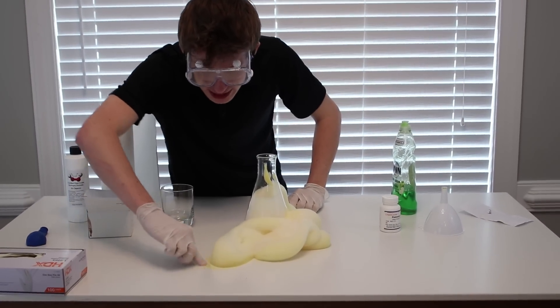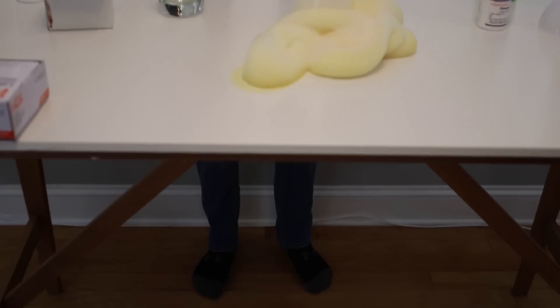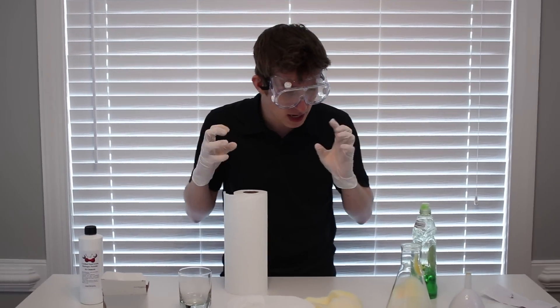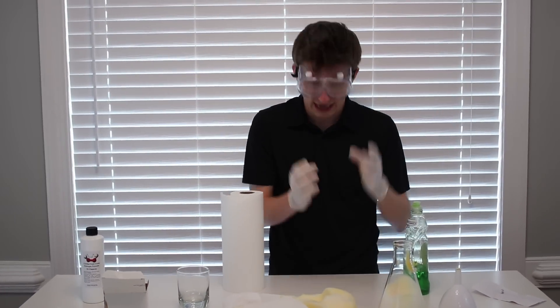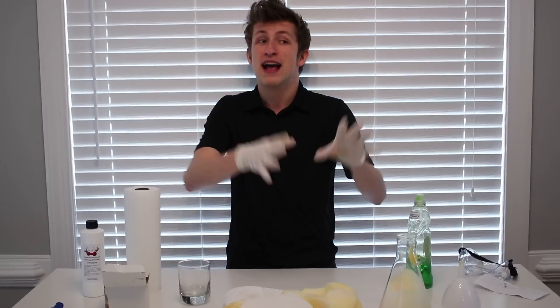As you can see, guys, it's literally just stained the table. Look at this. If we take this right here, guys, look, it's turned the vial yellow. You wipe it away, look what happens to it, guys. It's such a heavy and hot chemical reaction that it becomes super hot. That would burn my hands when I kept it on there for too long, guys. So this is why we have to take our safety precautions, and that is awesome, guys. So we're going to clean this up, and then we're going to try this on a bigger scale, guys.